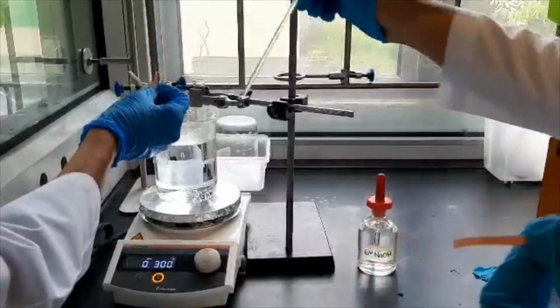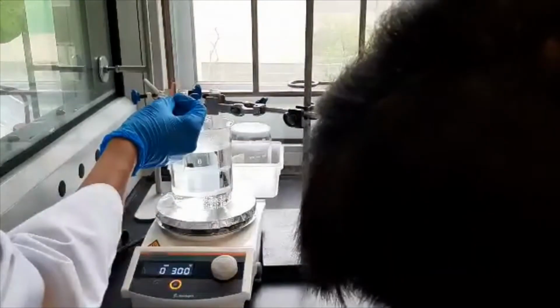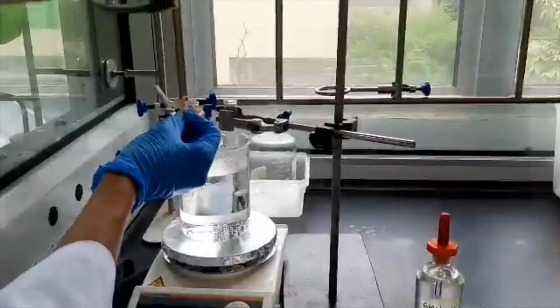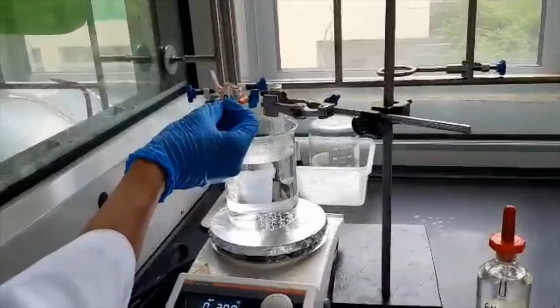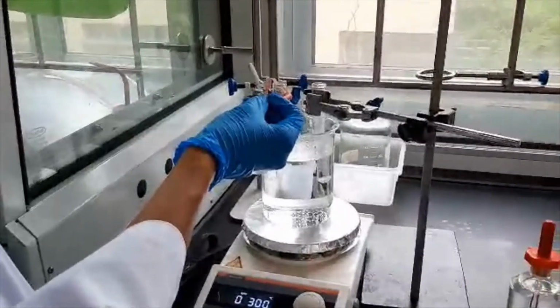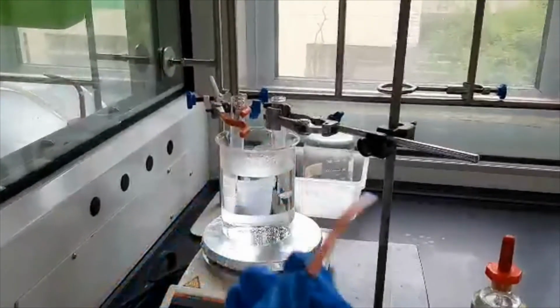When the water bubbles, Jonathan adds 5 drops of sodium hydroxide to test tube B, then uses a glass rod to stir, and our dear friend Ryan gladly helps by placing a moist red litmus paper at the mouth of the test tube immediately. Here, one must be cautious. Do not be mistaken, as the red litmus paper turns blue only because it touched the side of the test tube that still had drops of sodium hydroxide. For both B and D, the litmus paper remained red.